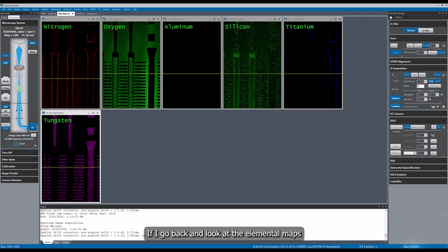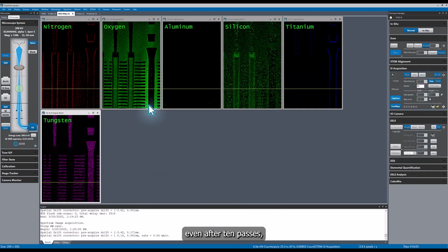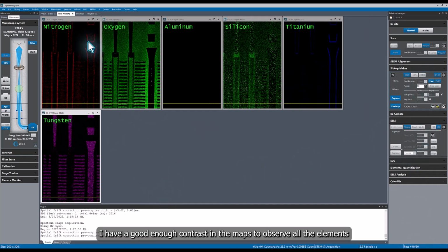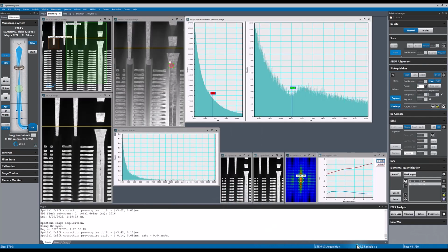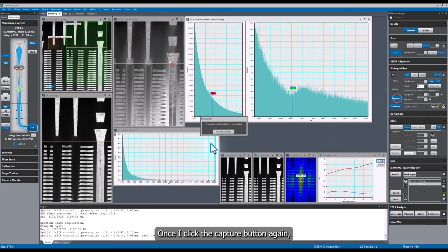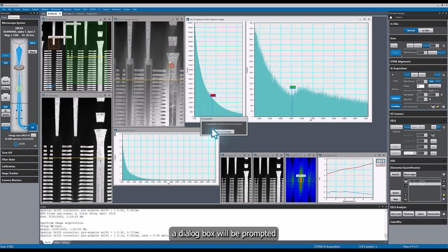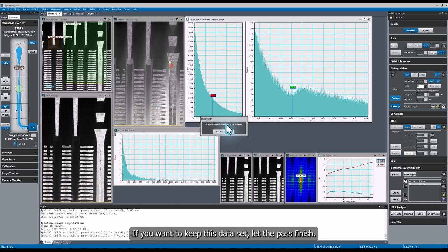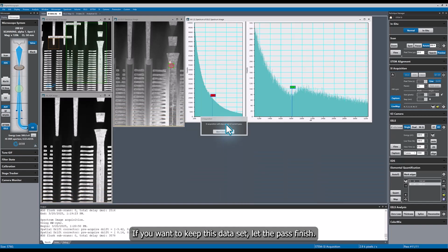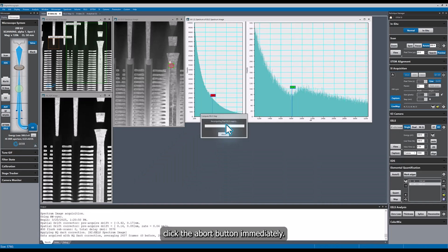If I go back and look at the elemental maps, even after 10 passes, I have good enough contrast in the maps to observe all of the elements, and I will stop the measurement. Once I click the capture button again, a dialog box will prompt saying that the acquisition will stop at the end of the current pass. If you want to keep this dataset, let the pass finish.